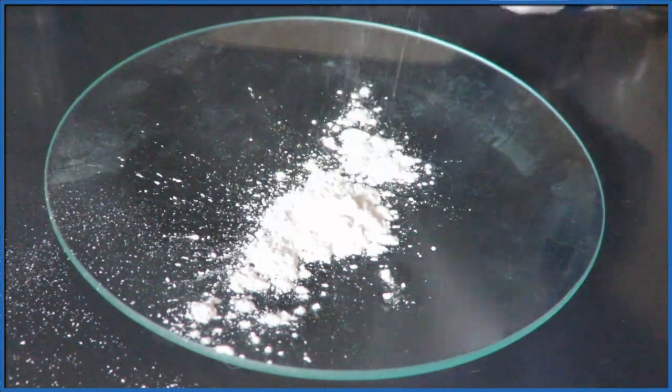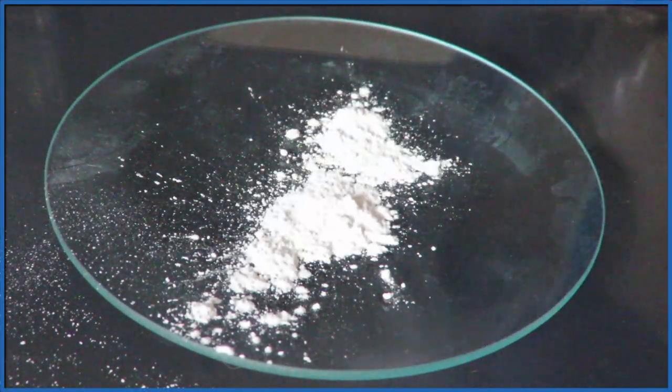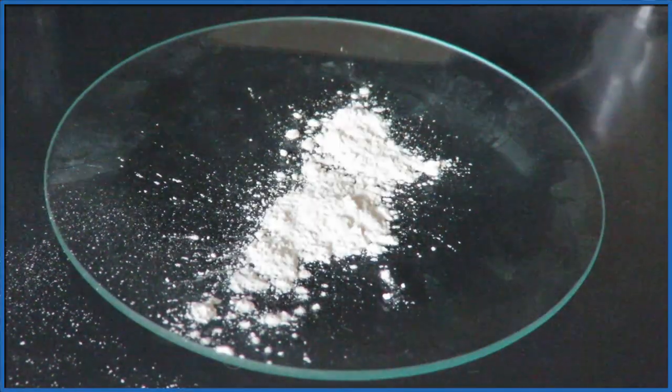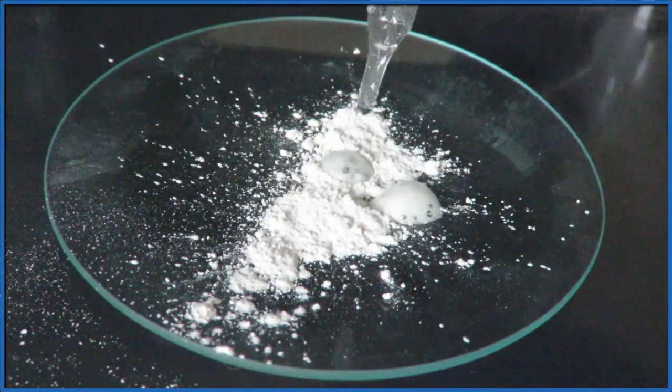In this video, we're going to take a look at what happens when we put calcium carbonate with hydrochloric acid, that's CaCO3 plus HCl.